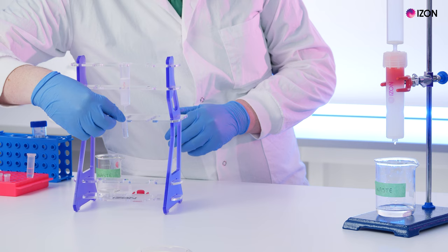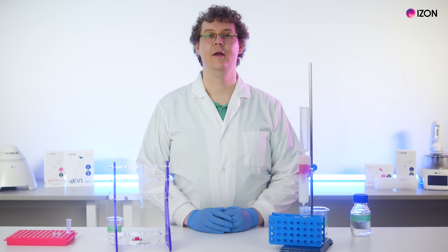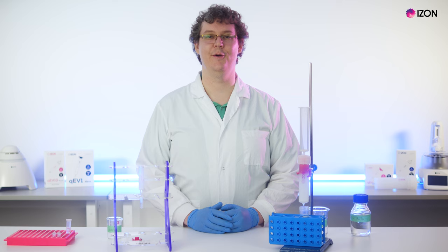Once the buffer volume has been collected, set it aside and load your first sample collection vessel.